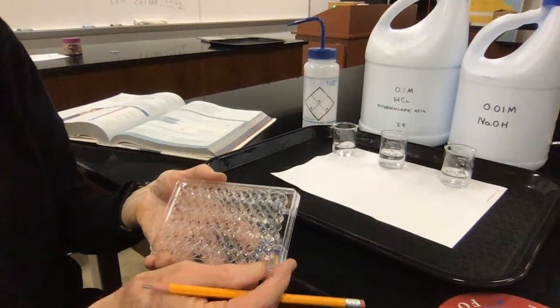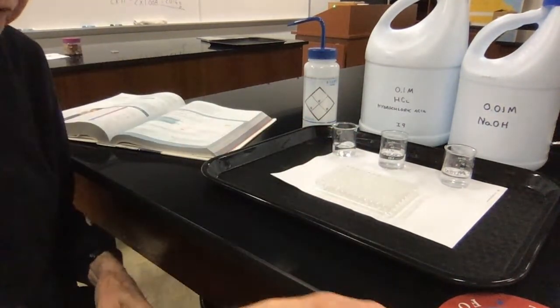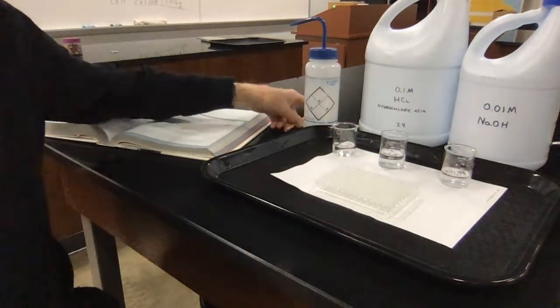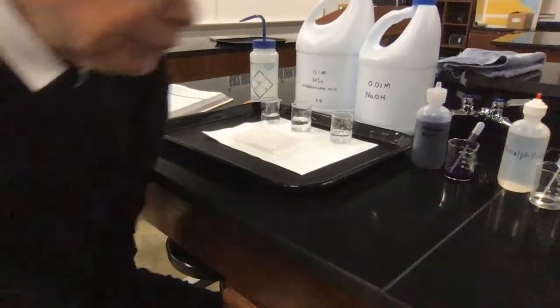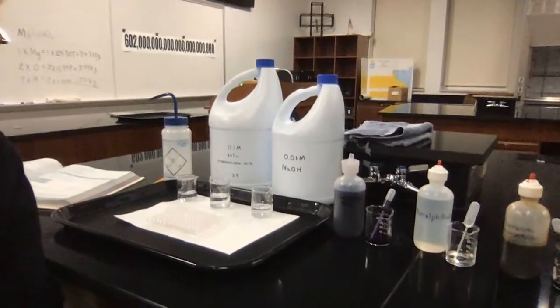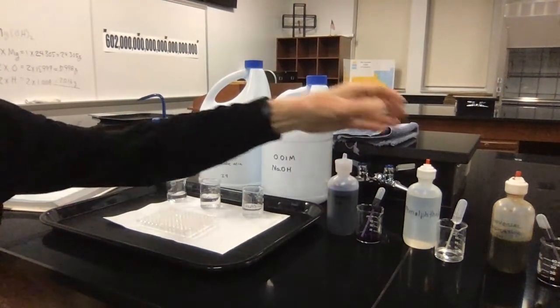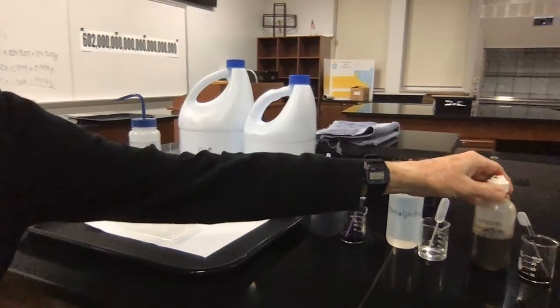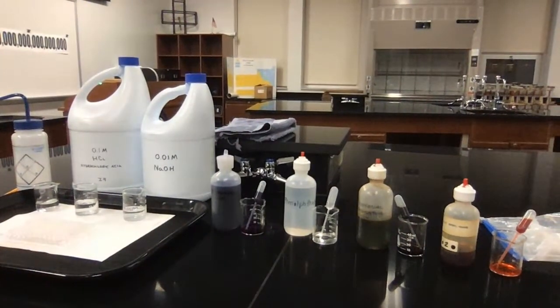It's just pure water. Now, here's where the experiment gets kind of neat. We're going to take the solutions that we have in here, and we're going to add to them some acid-base indicators, which I have a little further over on the bench here. And we've lined them up for you. On the far left, I have bromphenol blue. The next solution I have is phenolphthalein. My next solution is universal indicator, and far right has methyl orange.